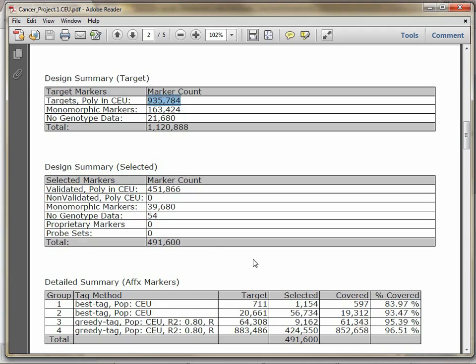Okay, so overall, for this design attempt, we've selected 491,000, which is definitely less than the 650,000 that would fit on one array. So this is good. It will all fit on the array. But there's space for another 150 or so thousand markers. So if you are interested, you could choose to add additional markers to this design attempt.